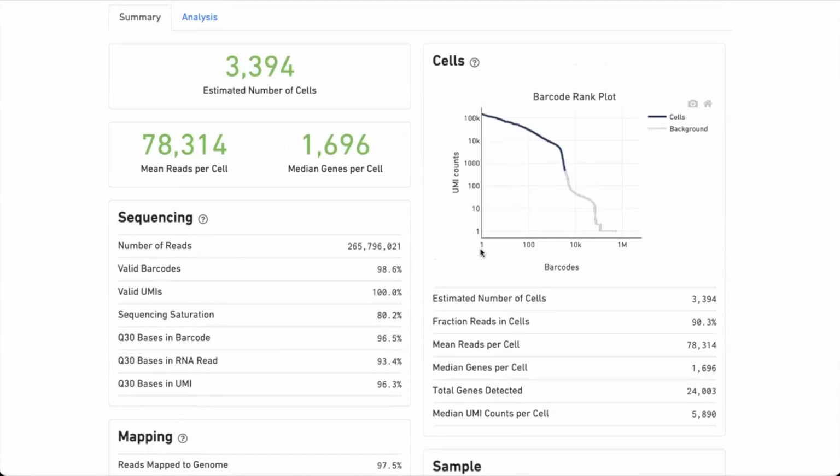So you're clear on that. Here we have all the barcodes sorted by size, right? And here we have the UMIs. And we want to find where we go from true cells to just background noise in this plot. In this case, I think Cell Ranger has some strict cutoffs also on just the number of cells. Yeah, but what I'm wondering mostly is why is the inflection point in the middle of this drop? Why is the cutoff set up there?